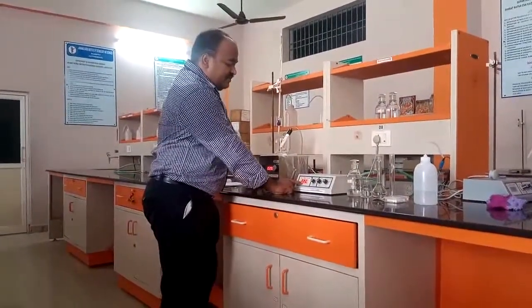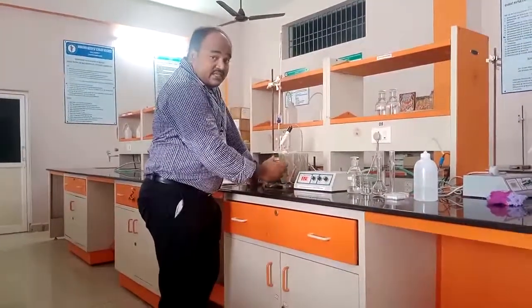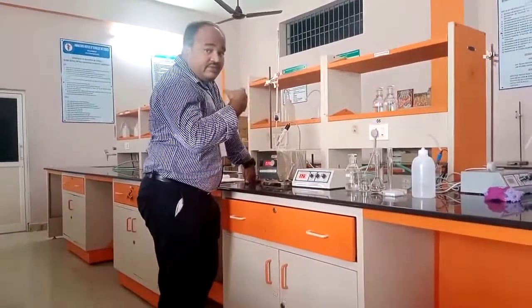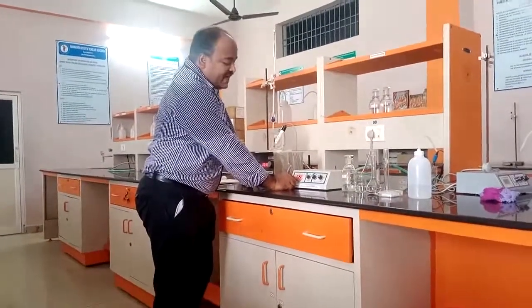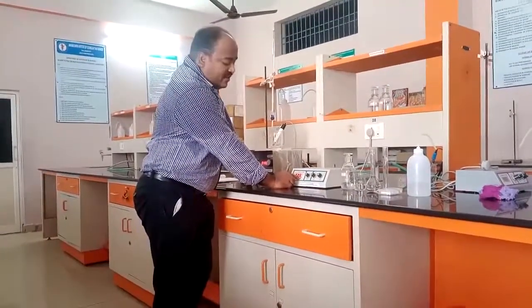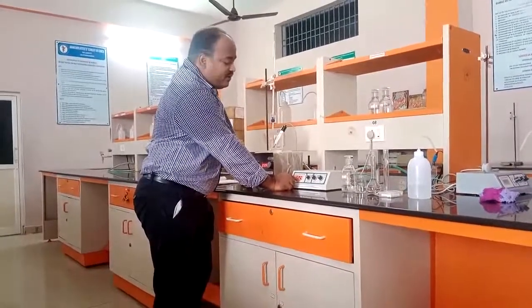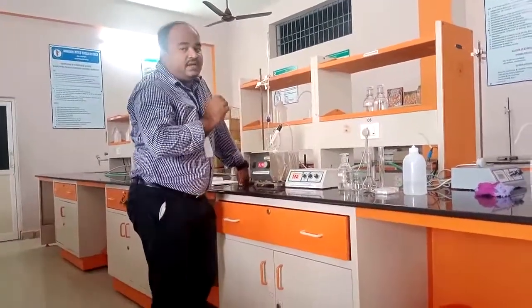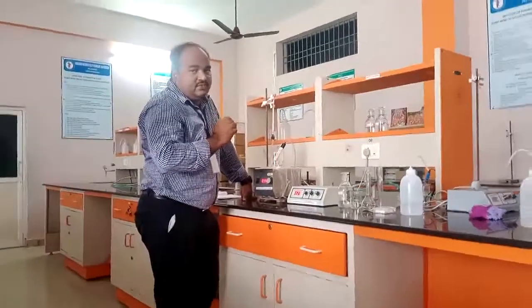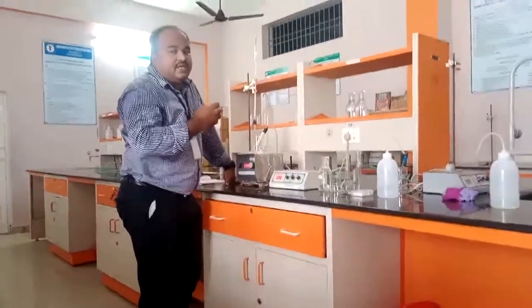Now it is increasing, not very drastically, but a very slight increment. Before it was 2.5, now it is 2.9. So 2.4 is the neutralization point of hydrochloric acid.